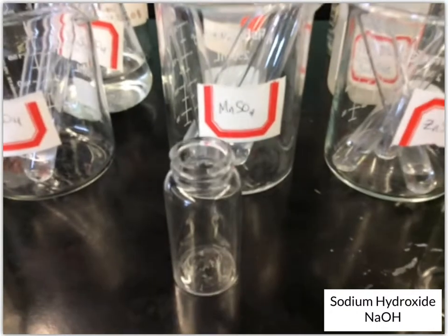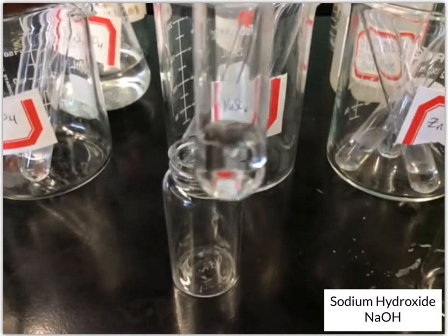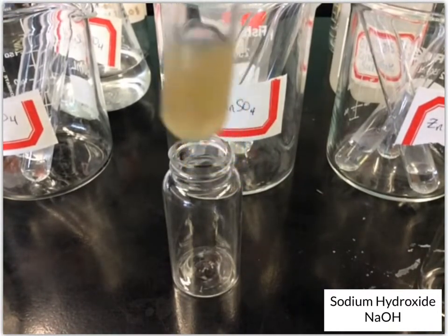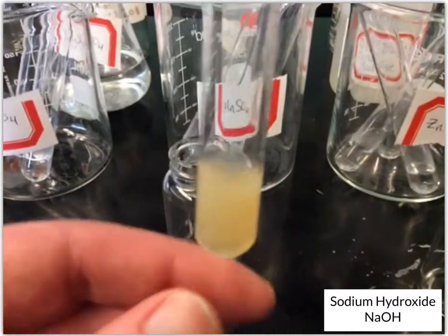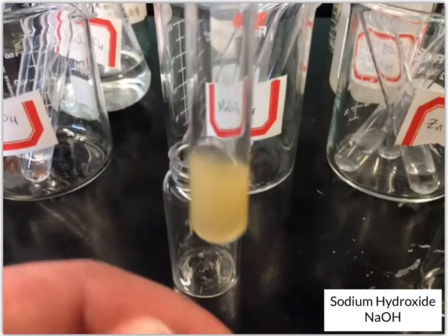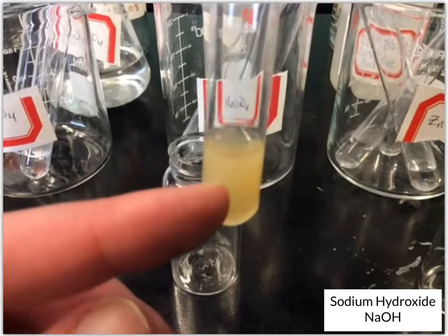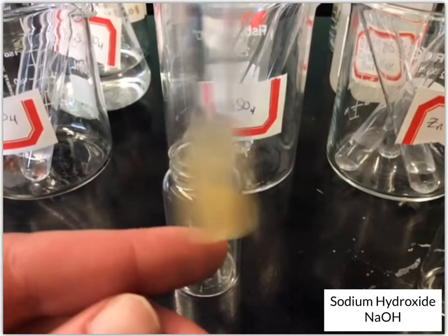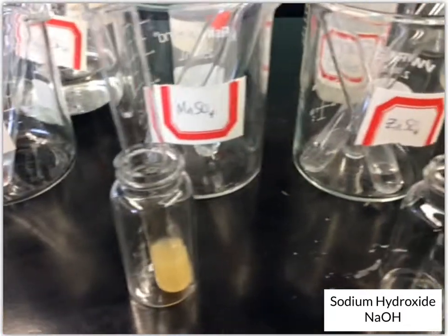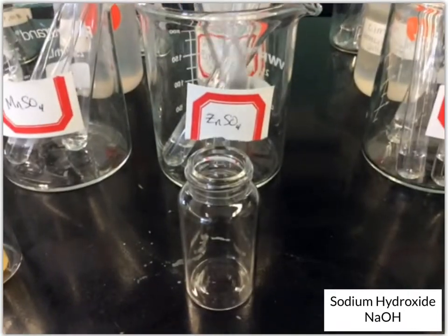Okay, next up, let's do the manganese(II) sulfate. Okay, now it's a little bit more interesting. Looks like we've got this kind of yellowish solution, but again, you can't see through it, so it's likely that this is some solid that's formed in there. So we'll give it a minute or two to sit there and settle. Let's move on to the zinc sulfate.